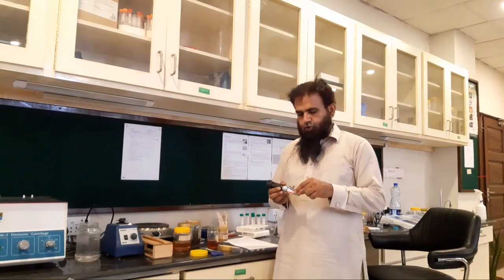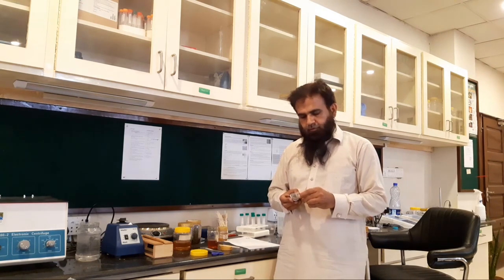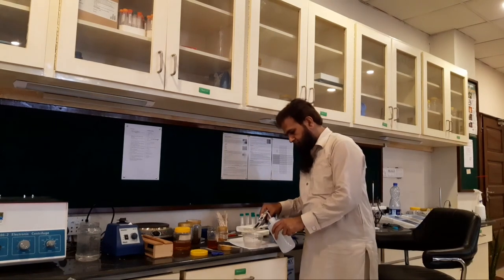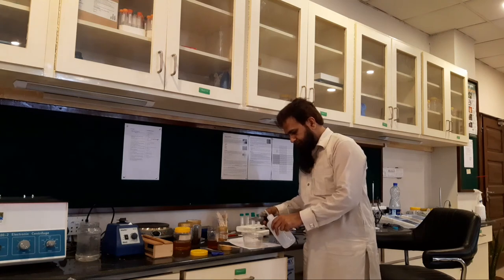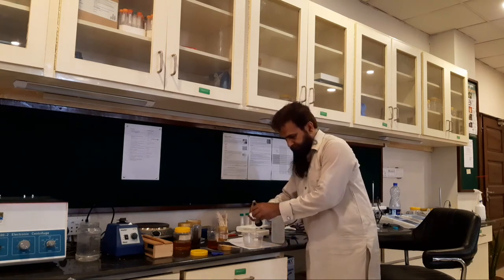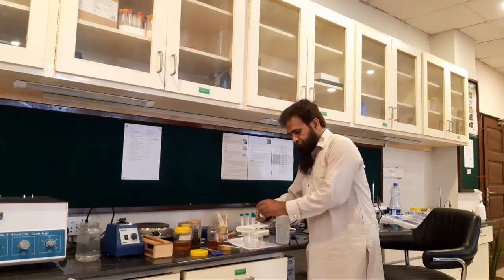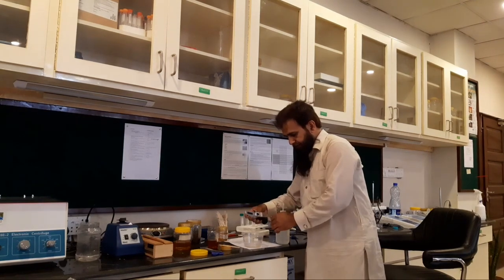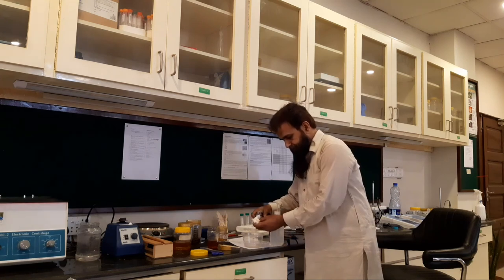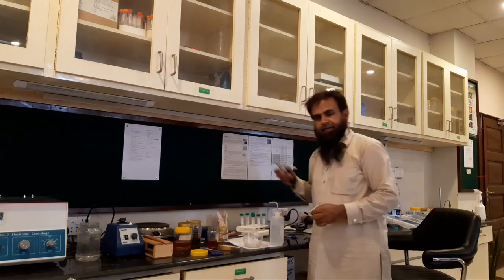After determining the moisture content, we should wash the refractometer gently. With the help of this screw, we can separate the daylight plate and gently wash with a wash bottle. It should not be placed under running tap water because the prism is very sensitive. We give another washing to the prism and gently clean it so that no drop of honey is left on the prism. Now the refractometer is clean and ready for another reading.